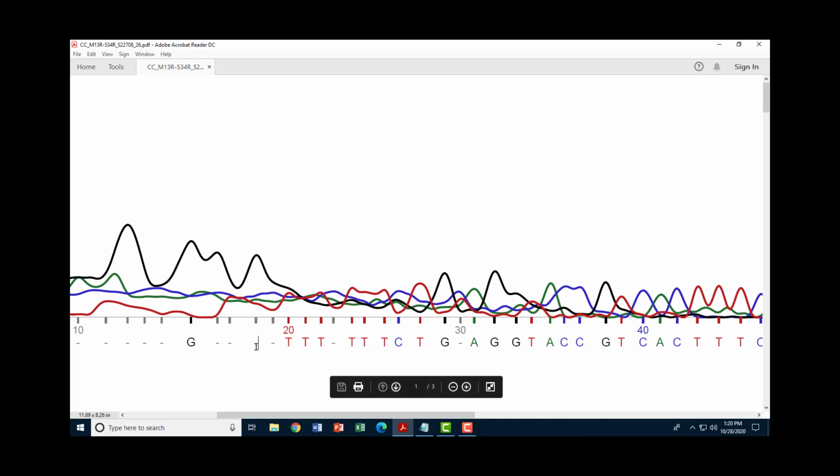Now we go to this position. If I look at this, I see a pretty good peak for guanine. I'd probably put guanine right there. So when you go through here, you would look at these and try to make those kinds of judgment calls. This position, really hard to say. We have multiple overlaps, different colors. We have guanine being the strongest, but it's on the downslope. But I do see something on the upslope here.